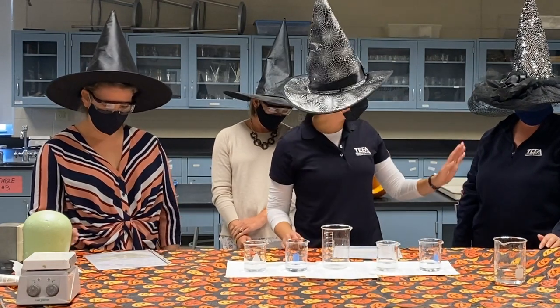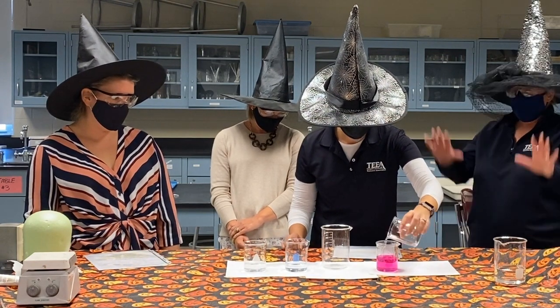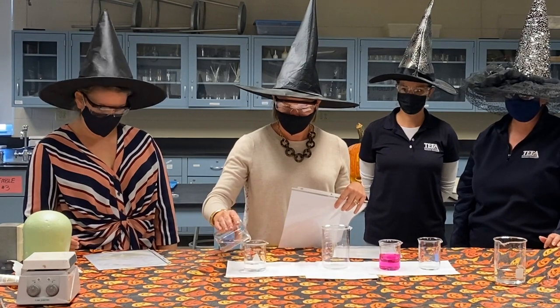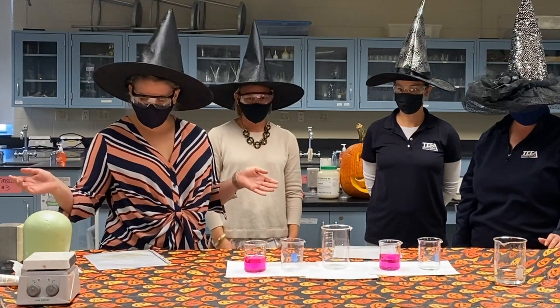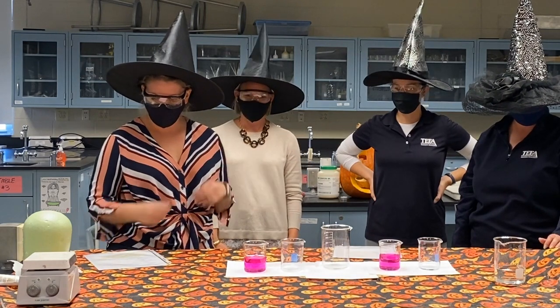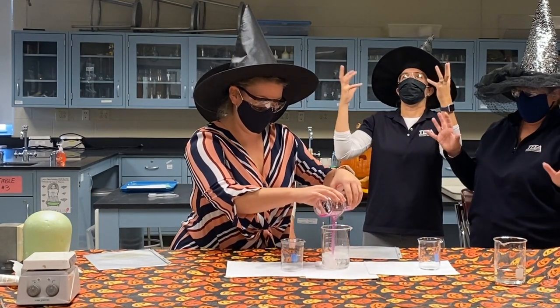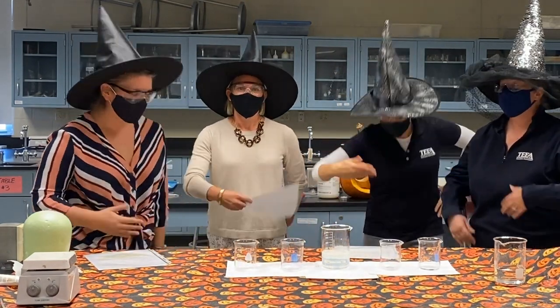The pink is here. Pour the brew in. The color will appear. We need more! Now there are 2 glasses of pink, but no one asked me what I think. I will invoke my powers to make it clear. Be gone, pink. Watch it disappear. And so you see, your Halloween treat today is a little chemistry.